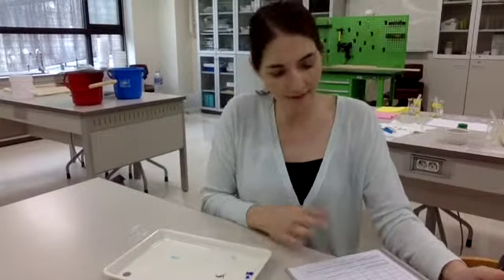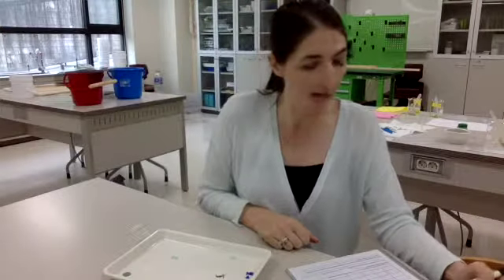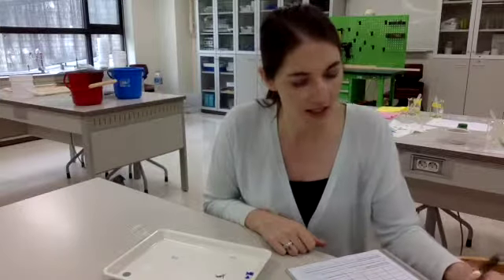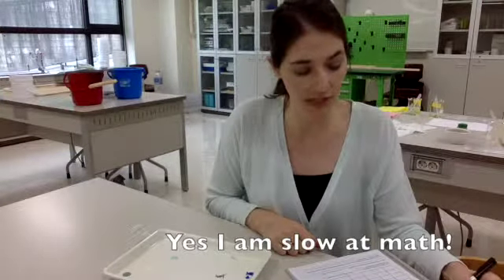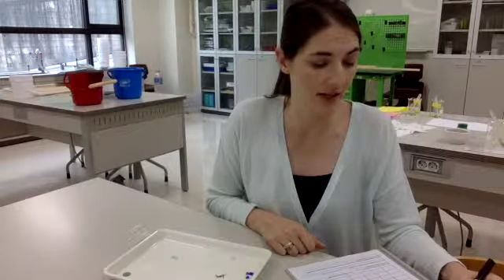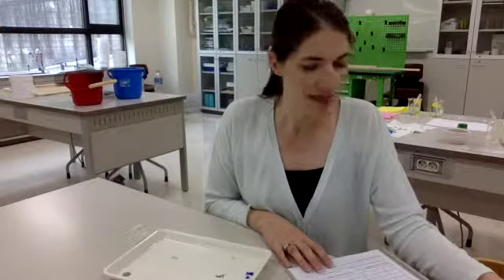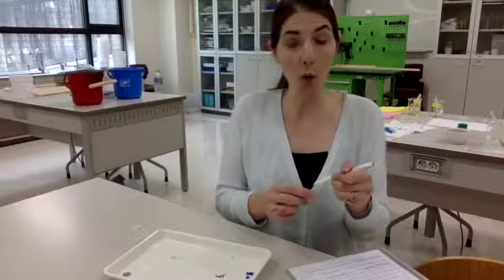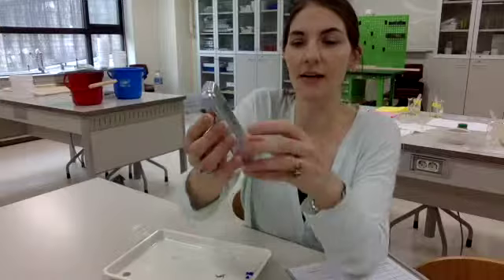Okay, so I've inventoried what I found, and now I want to add it up. I want to add up the total number of microplastic pieces that I found. So I have found 12, 15, 23, 27, 28 pieces. So 28 pieces in my sample number 1. Now, here comes the fun part, total mass in grams. You are also going to get a scale.